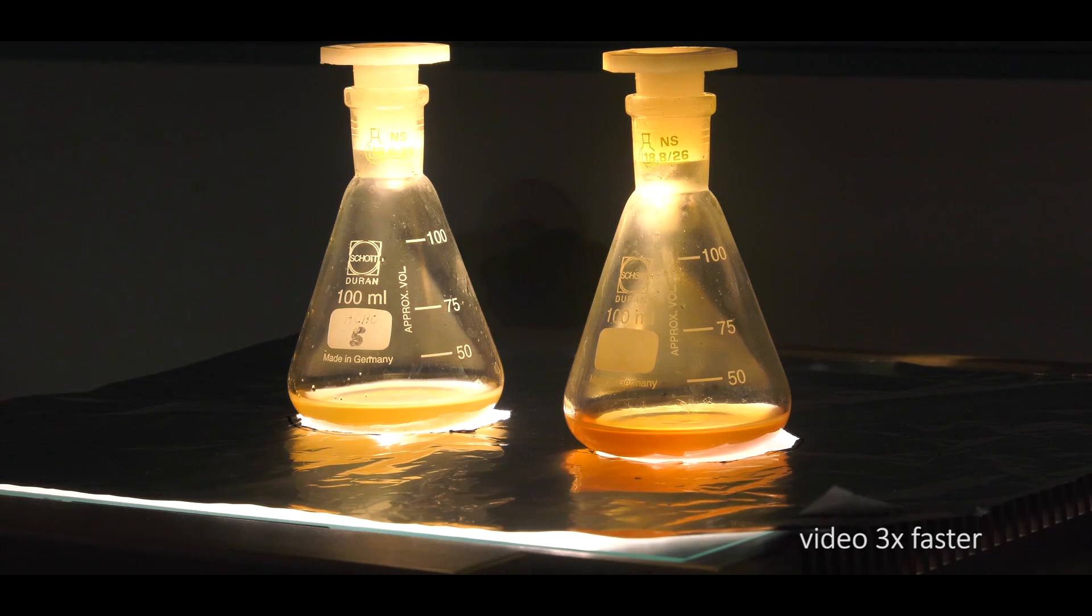Afterwards, put the flask on an overhead projector and turn on the lamp. The brown color of the solution will disappear within 2 minutes.